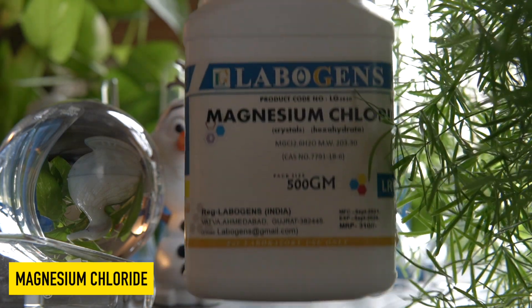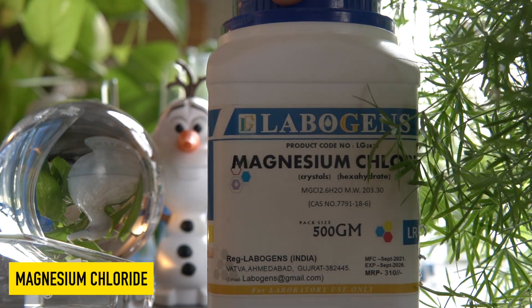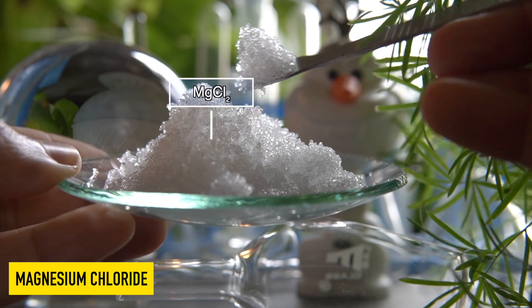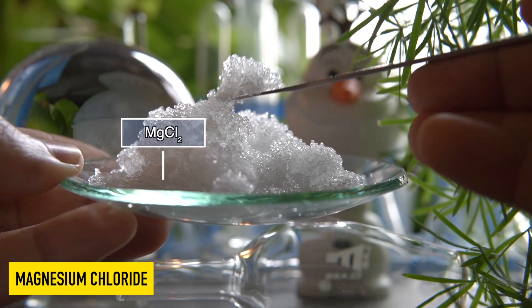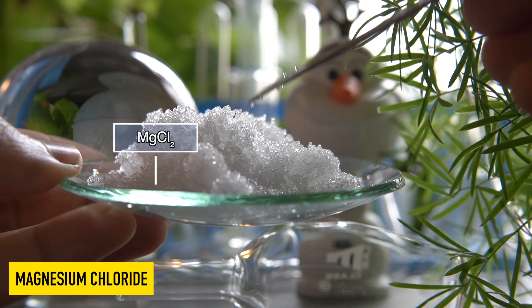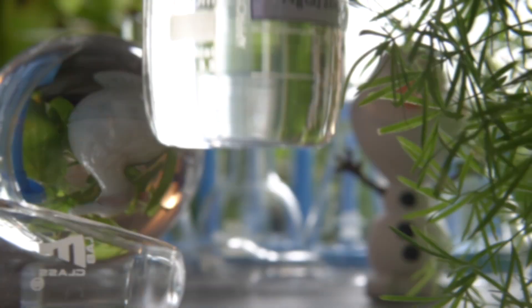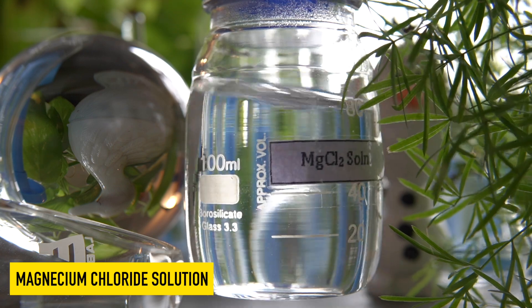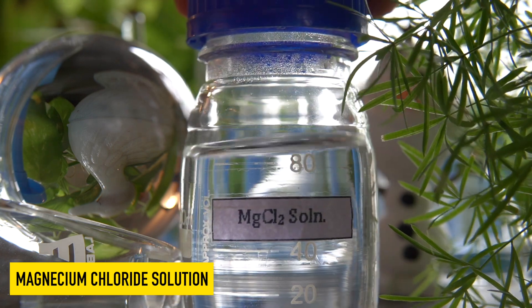This is Magnesium Chloride, a deliquescent white solid. It means that it has a tendency to absorb moisture from air and dissolve in it. It is very easily soluble in water to make its solution.